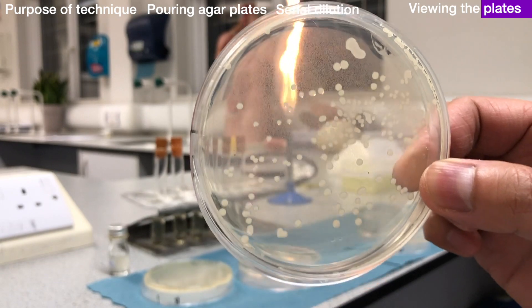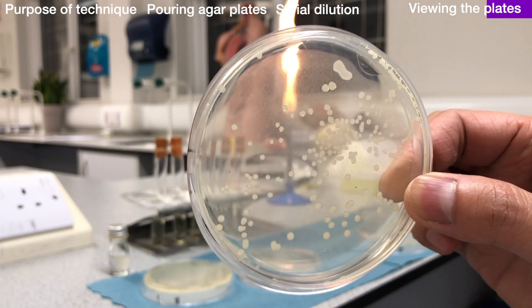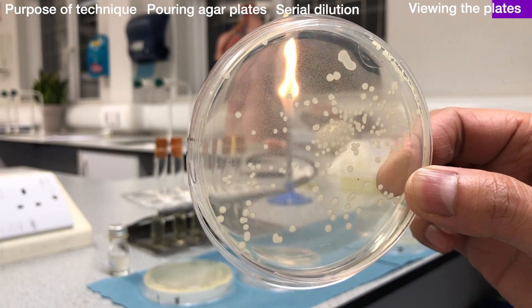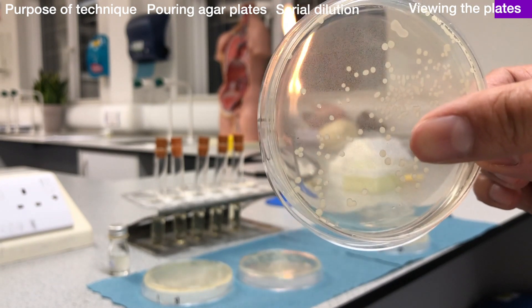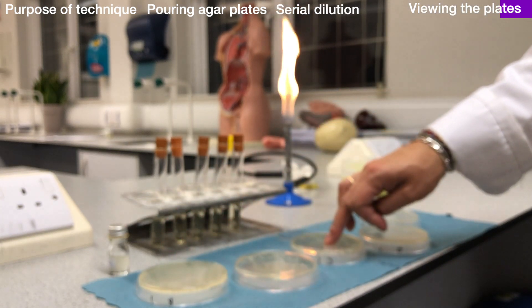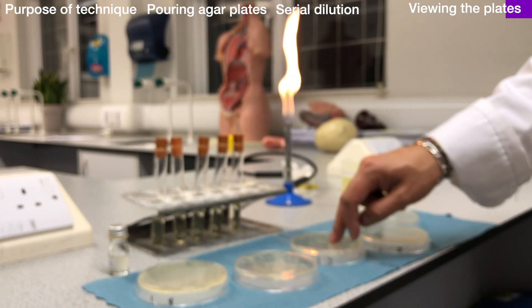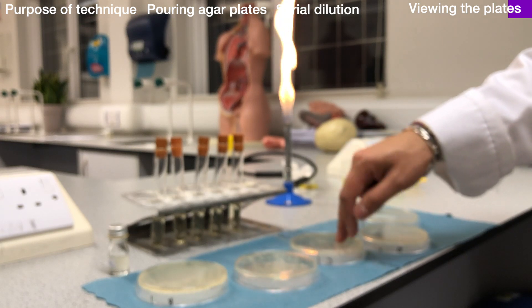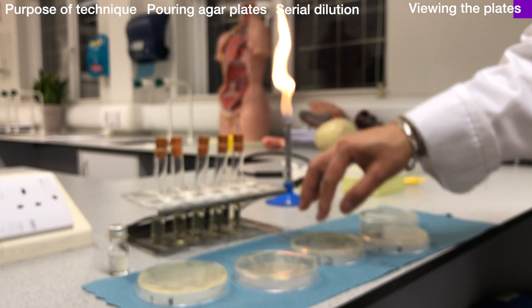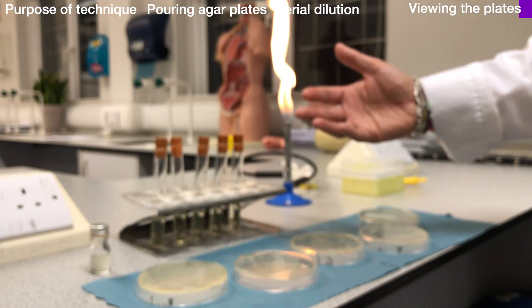This plate here is more along the lines of what we would like. We have distinct colonies. We can count these colonies and assume that each one formed from a single bacterial cell on day one and has now resulted in a colony. We count the number of colonies on this plate and multiply by the dilution factor — which in this series was 1 in 10, 1 in 100, 1 in 1,000 — and also take into account that we only inoculated with 50 microlitres, which is 0.05 cm³, so we multiply that again by 20, then by the dilution factor, and we would then know the density of bacteria in the original culture.